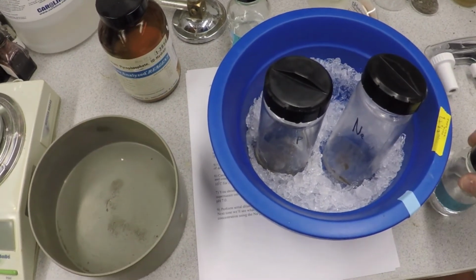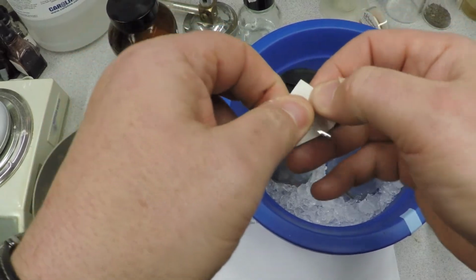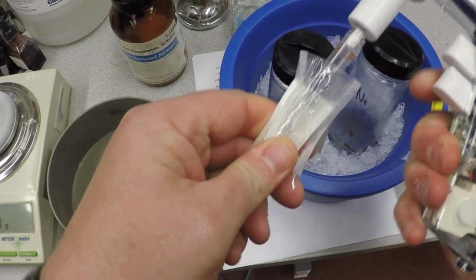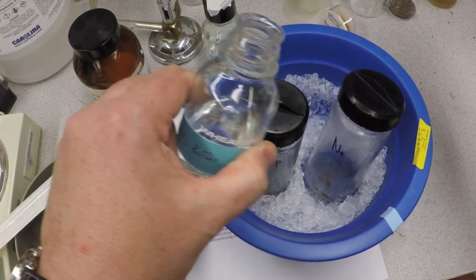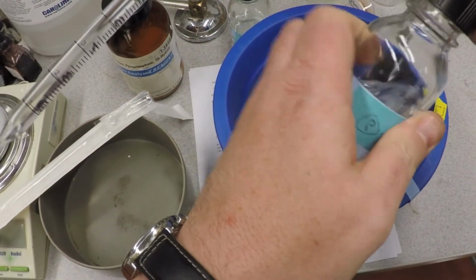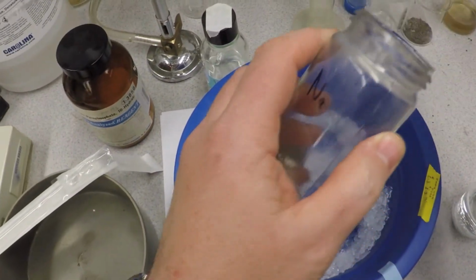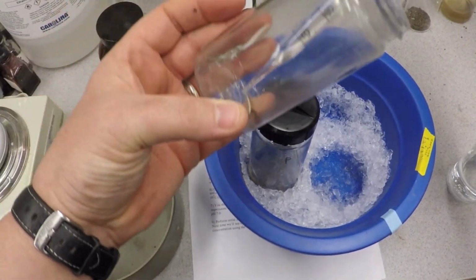Okay? So you take, we're going to have 5 or 10 mil pipettes. It depends on what we have in the lab. This happens to be a 10 mil. And to resuspend the pellet, you take a pipette aid and you take a little phosphate buffer and you suck up your 5 mils. And you take this guy, and we know where our pellet is. Our pellet is down there.